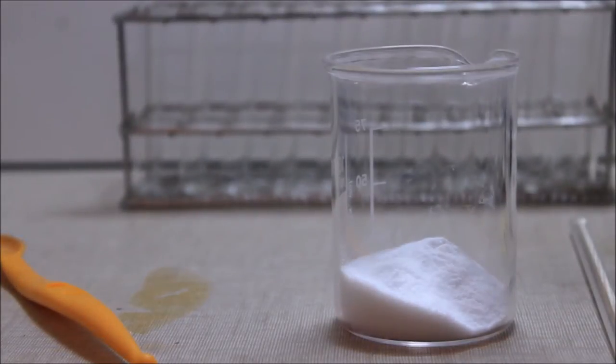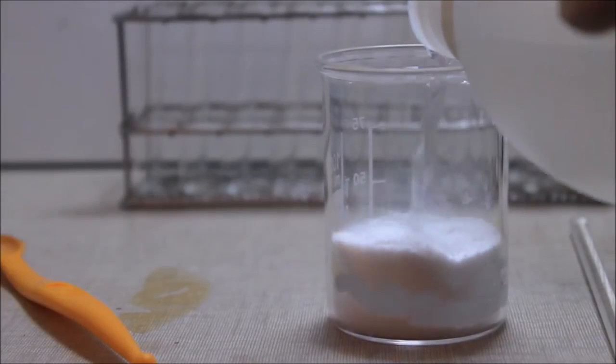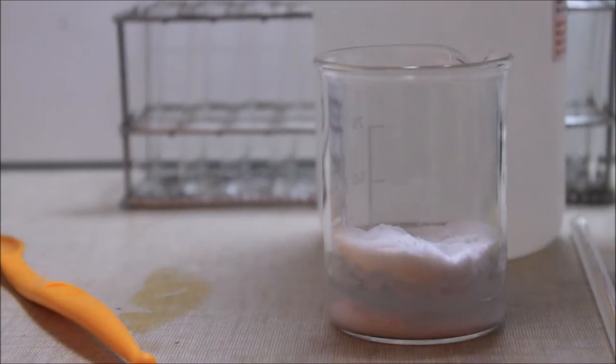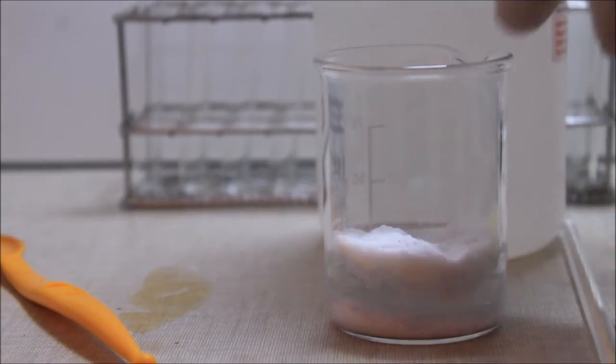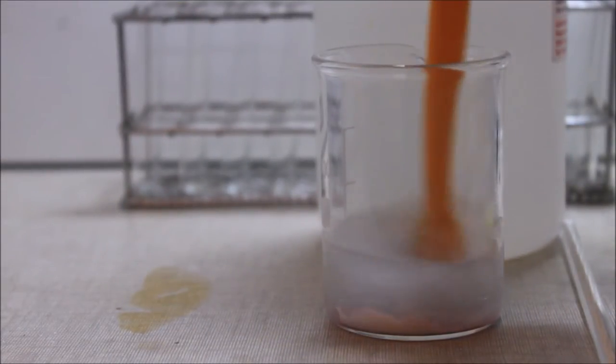Now we weigh a given amount of silica powder. There are some rules to estimate the amount that you will need for the chromatography. In my case I use about 8 grams of silica powder. The silica powder can be obtained by grinding silica kitty litter. This must be done in a well-ventilated area and with safety cautions, as silica powder is quite dangerous. In professional labs, silica 60 is typically used as stationary phase.